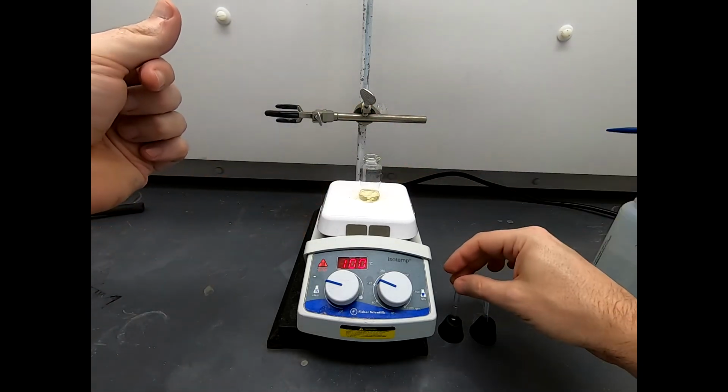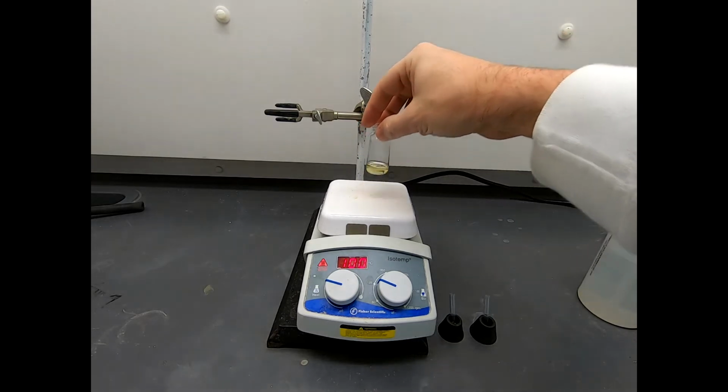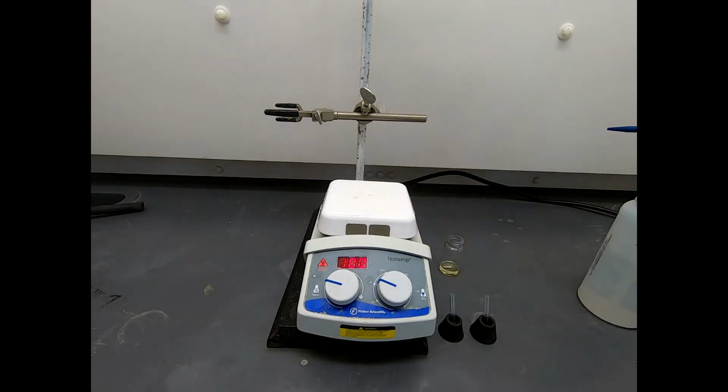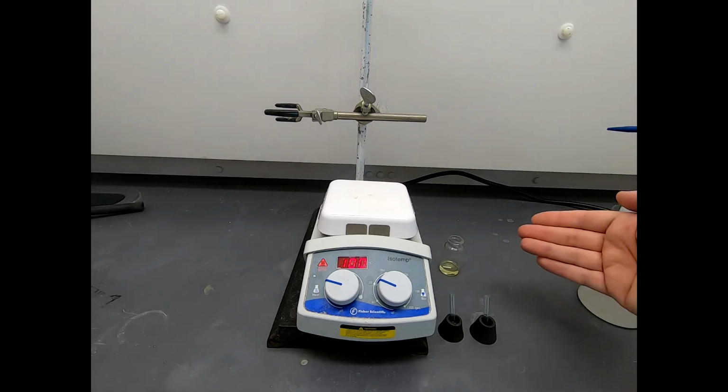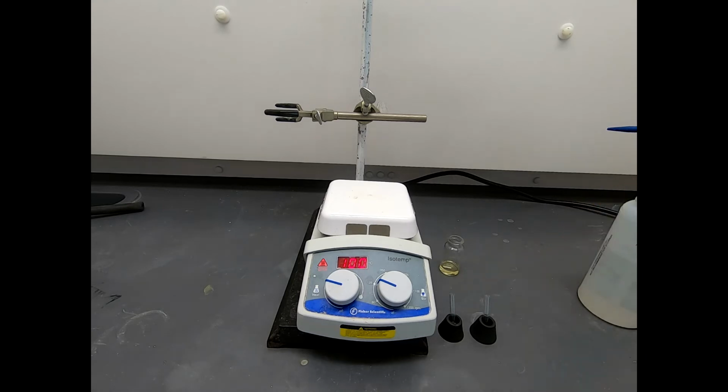And here's our starter material, and I'll use these two samples as the basis for a 3-lane TLC plate. Let me come right back in. Note the procedure did say don't heat this too long. So while I'm running the TLC plate, because the TLC plate might take you 10 or 15 minutes, I'm going to take this off the heat and just let it come down to room temperature. Because in case this is already complete, I don't want to be cooking and potentially destroying any product while I'm trying to get the information to determine whether the reaction is complete. So we'll take that off the heat while we're performing this TLC.